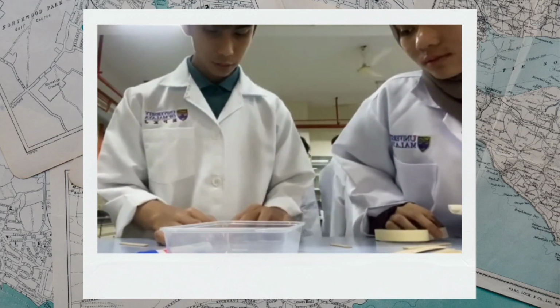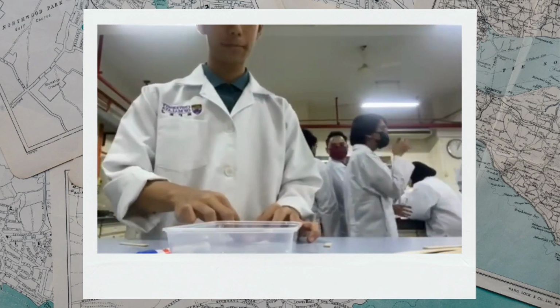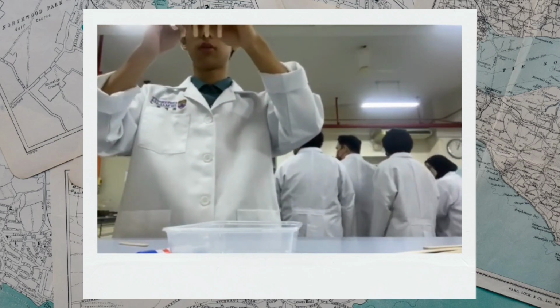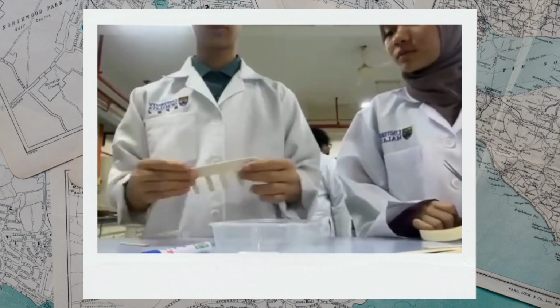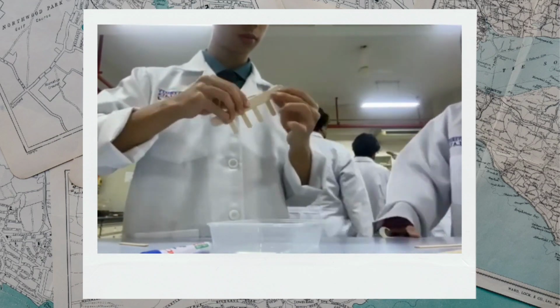When taped to the side of a regular sized craft stick, each segment should hang down so it sits just above the bottom of the small plastic box, approximately 1 to 1.5 inches in length depending on the depth of your box. Cut 5 of these teeth and tape them to one side of the regular size craft stick. Ensure that the teeth are evenly spaced, hang down to the same level, and all fit inside the box.